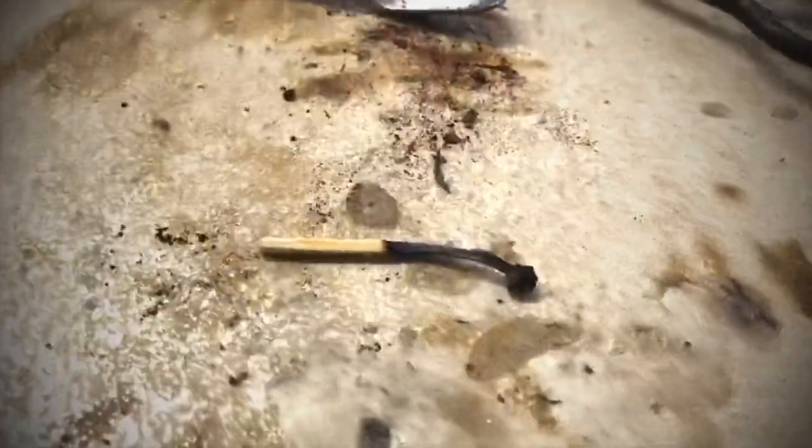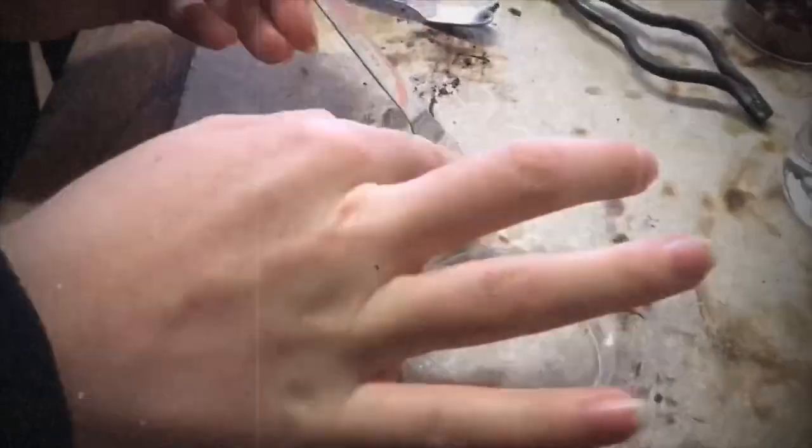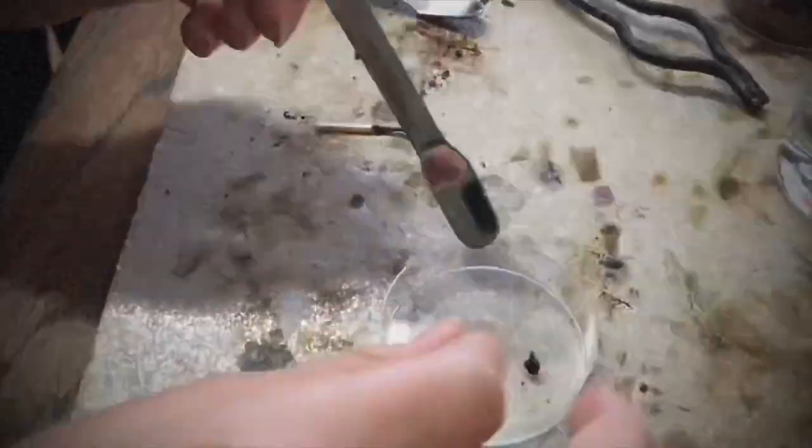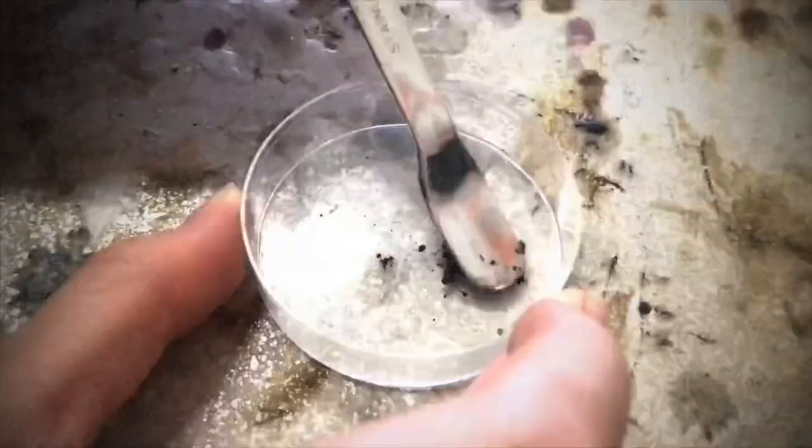We're going to leave that match to cool down. Now that it's cooled down, we take off the head and pop that in our petri dish and crush it up into small fragments.